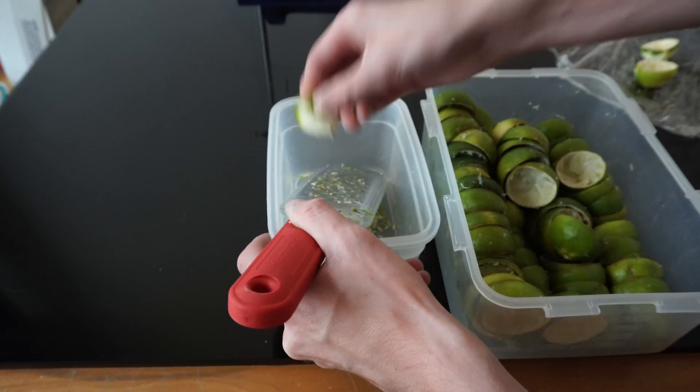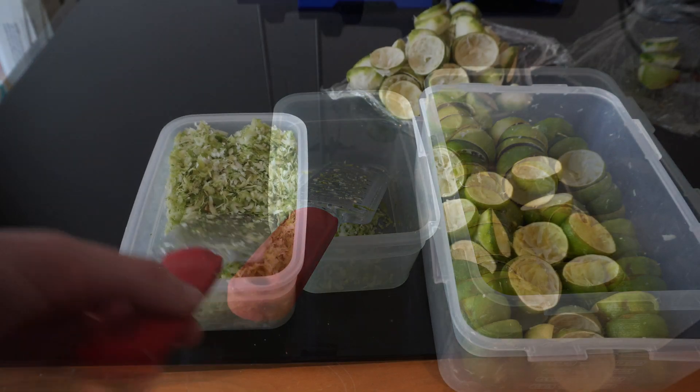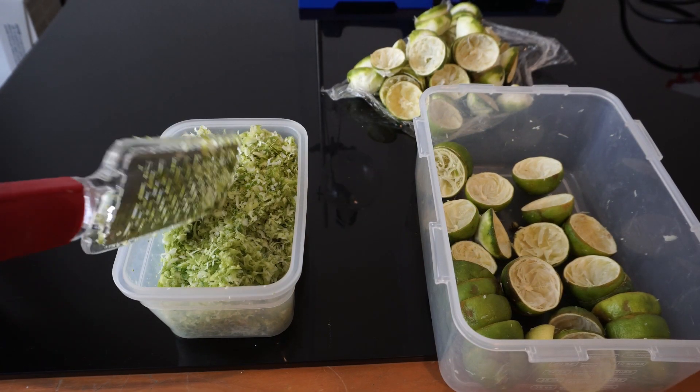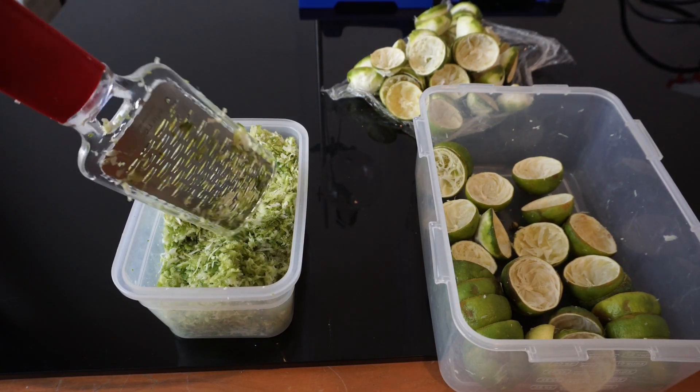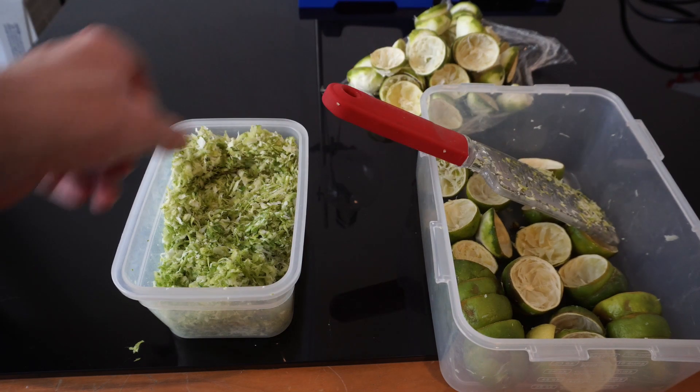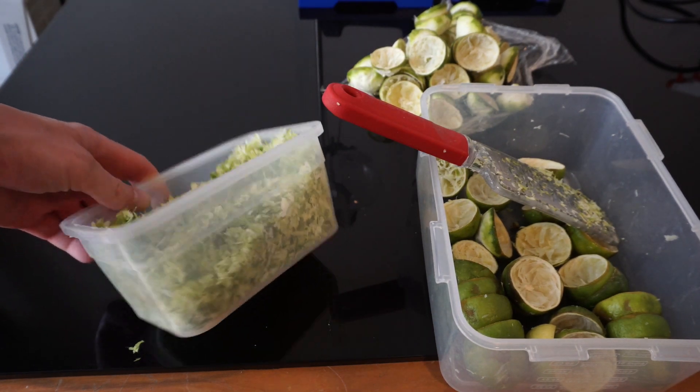We will simply distill the lime zest once. Naturally, the limonene is extremely hydrophobic, which means it doesn't mix with water, so it should naturally separate in our receiving flask.